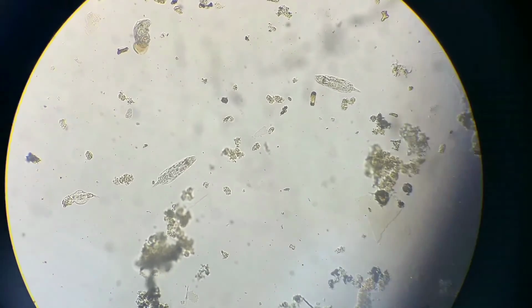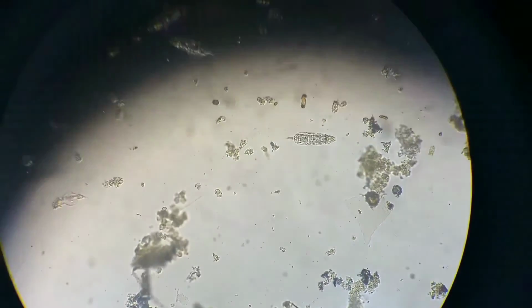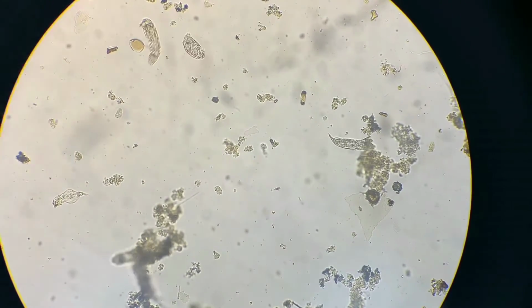These are the characteristics of protista. Nuclear membrane surrounds the DNA of the protist. The majority of protists are motile, or able to move, and many of them inhabit aquatic habitats. Protists have complex life cycles that can include sexual and asexual reproduction. Protists consume, absorb, or produce food using photosynthesis. This is what you can see as the result of our hay infusion under a 10 times microscope.